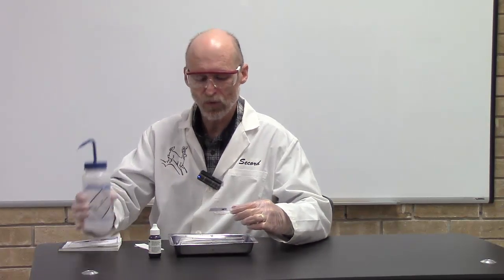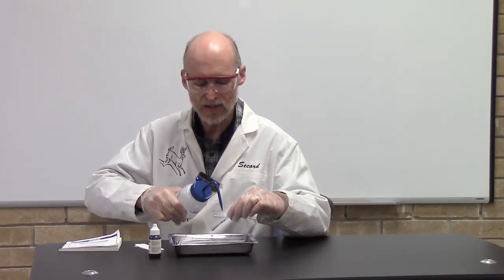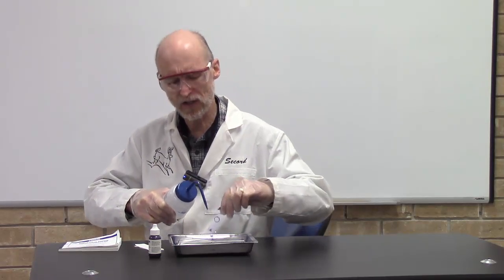Then, after it's penetrated for one minute, we rinse both sides of the slide. We want to make sure and get all that stain off of that slide.